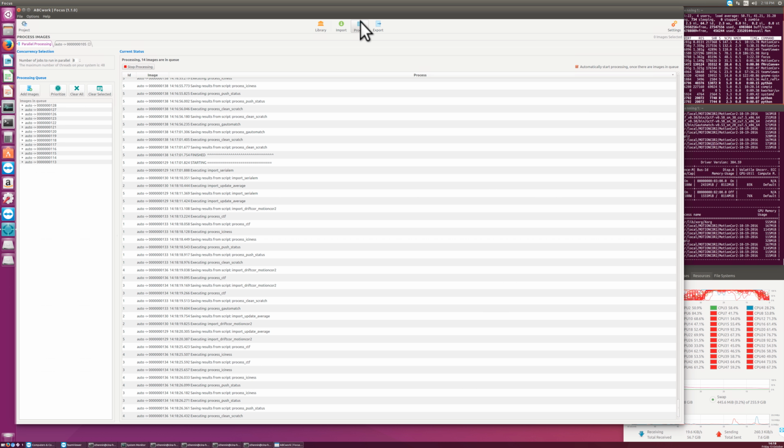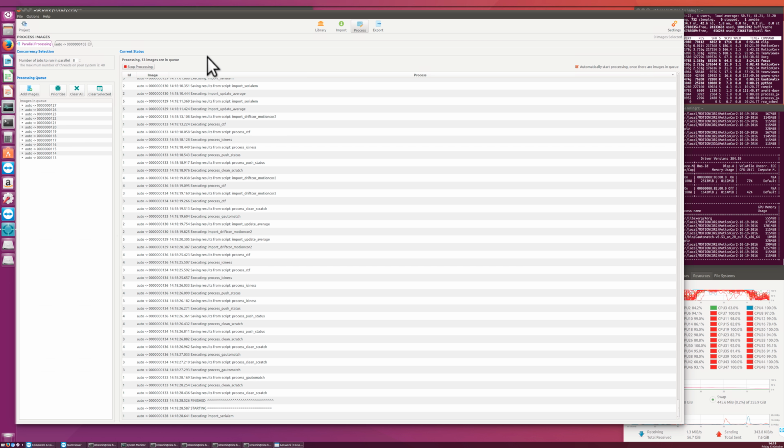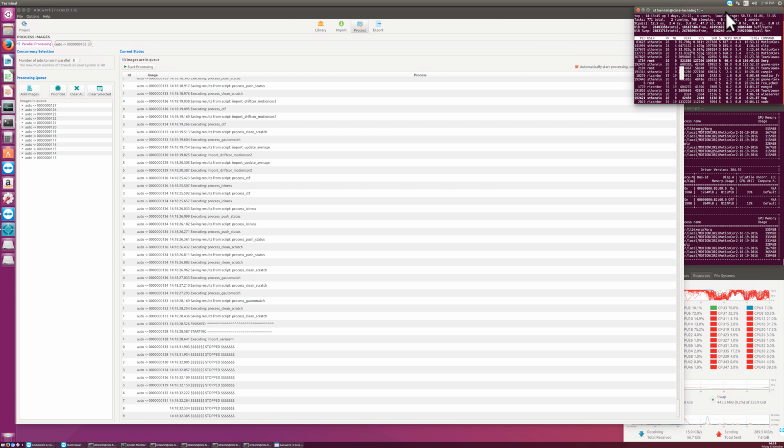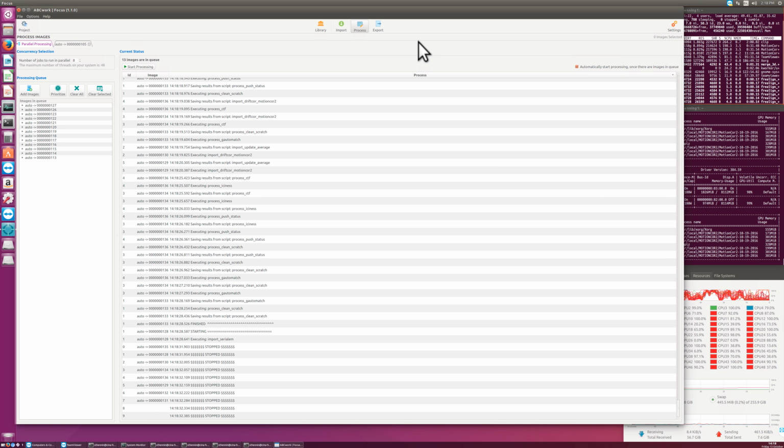So this is still processing, and for the time being I stop the processing queue here. The last ones that are still processing, they are still running. MotionCor is still running a bit, and Ricardo uses this machine with Frealign, and that's why it's also slowing down this computer. So in the end, when processing has finished, and I should still wait for the last two images here to finish, those are the ones that are still running here, and the batch queue should not start again, but I think it doesn't if I stopped it.